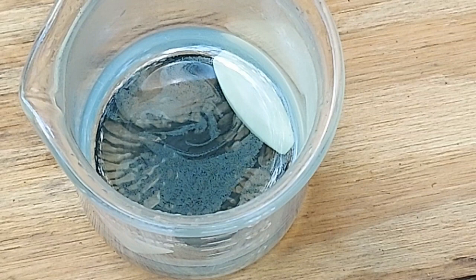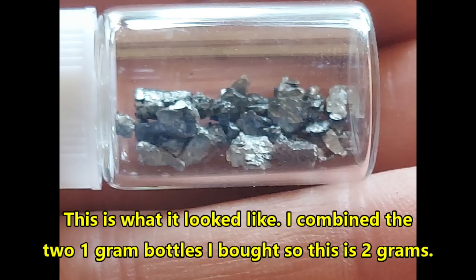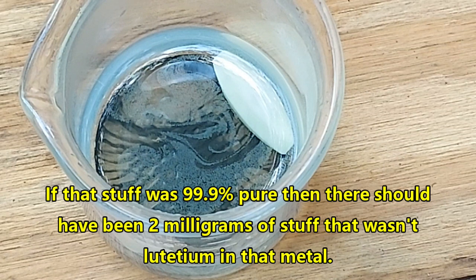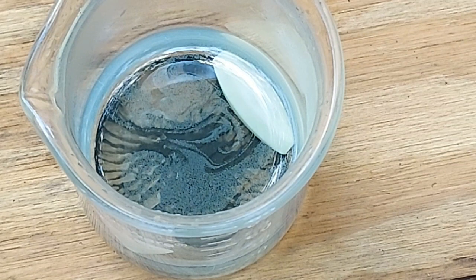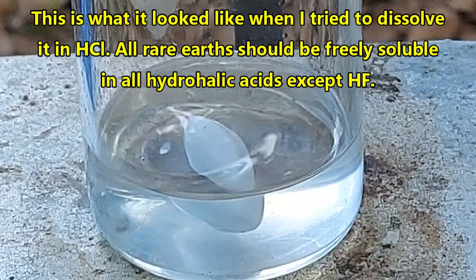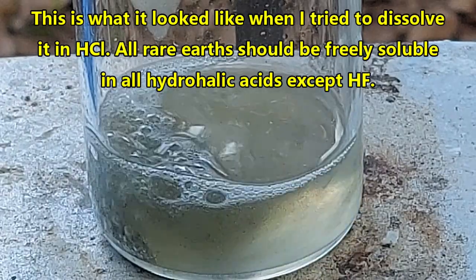So I bought 2 grams of what was supposed to be 99.9% pure lutetium from a vendor on eBay called Luciteria. I had heard other people say that they had had issues with this vendor in the past, but up until now, I never really had, at least none that I've known about. But I took this 2 grams of what was supposed to be 99.9% lutetium and tried to dissolve it in hydrochloric acid.